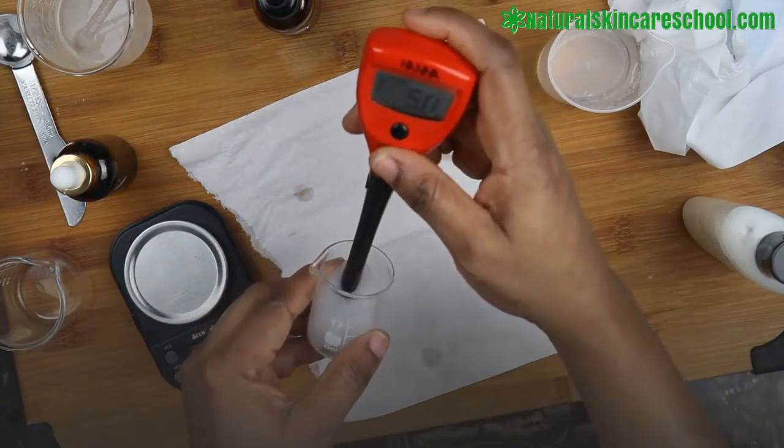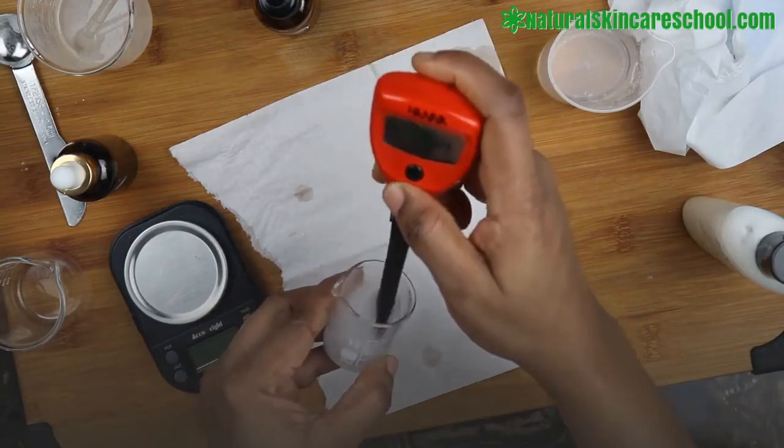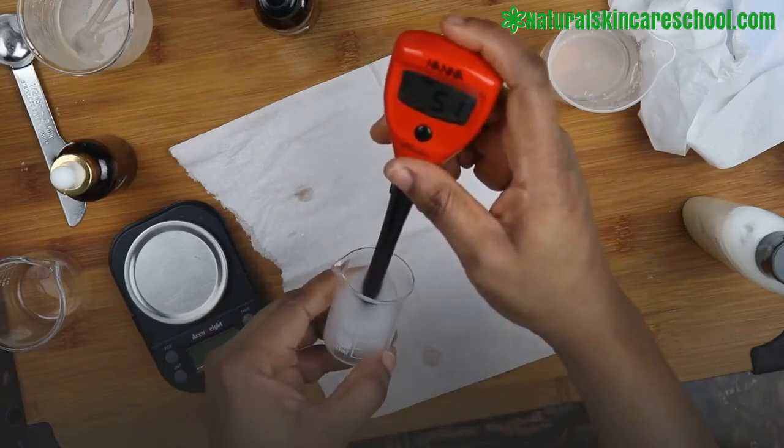Turn on the meter and wait for the reading.